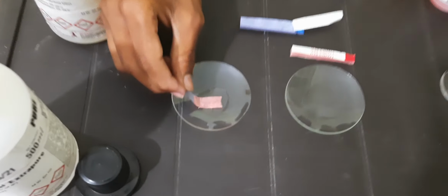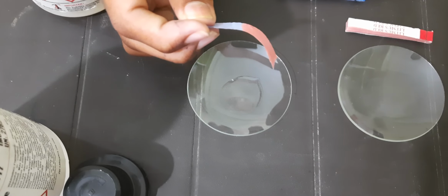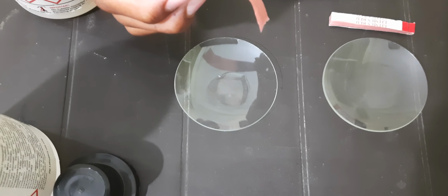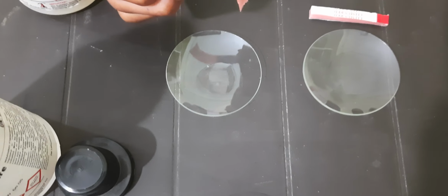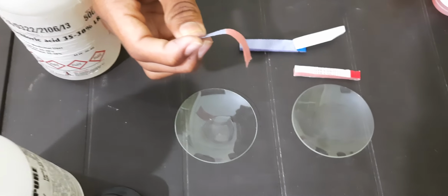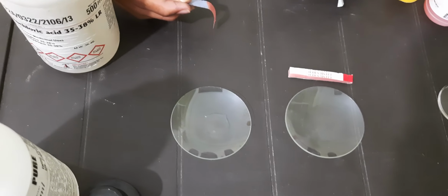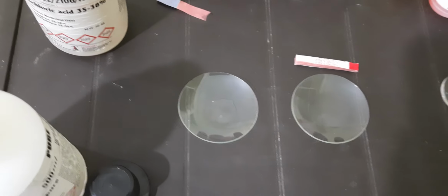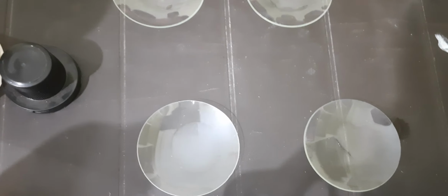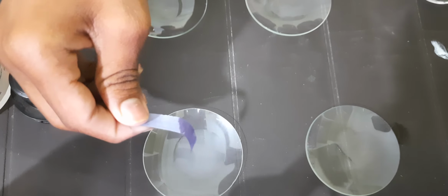Then how is it changing? Red. So now tell me, acid changes the blue litmus to red color. Okay, acid changes the blue litmus to red. Now take out that paper and take the same blue litmus test with the base. No response with blue litmus.